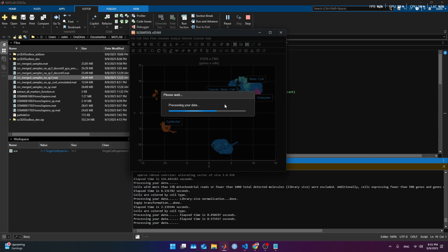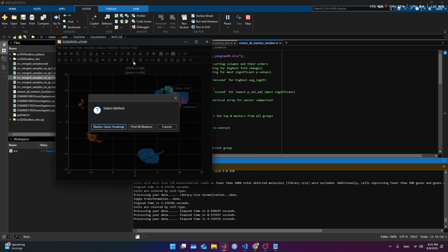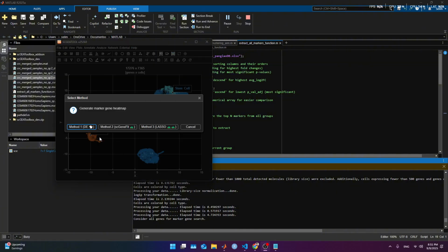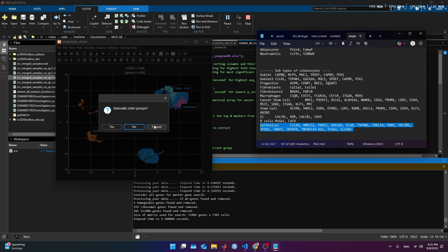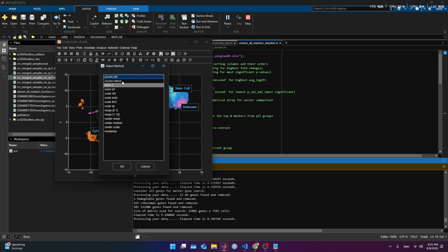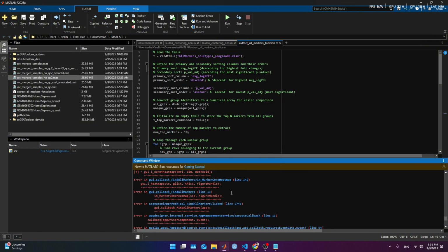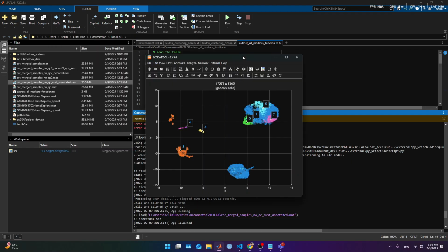And here I want to show one thing before closing this and doing the process I want to do. If we hit here on the heat map marker and then the heat map, now to the Panglao, and I want to look at the cell type, method DE, this is what I tried to do last time. It's gonna do the heat map of the gene markers. Don't order, A and B, normalization, then row wise, and we are gonna use standardize it. We can explore it with different, oh, didn't work, huh? Should I try something else? It's supposed to be fixed. Wait a second, I'm gonna see if I have the latest version. Alright, seems like the gene marker heat map is still not working properly, needs to be debugged. For now, we just keep it like that, and we're gonna revise that later.